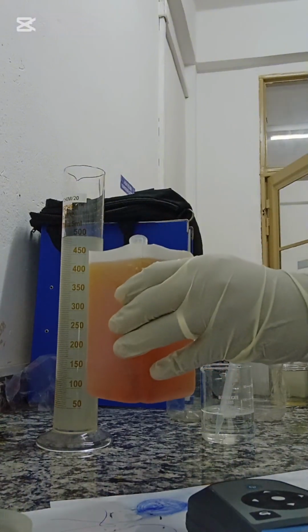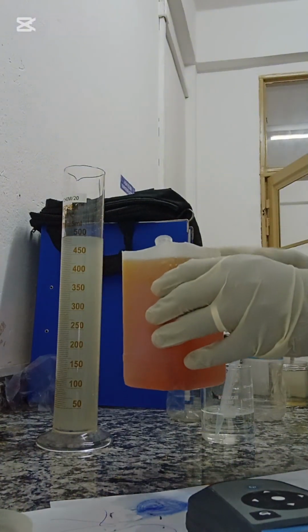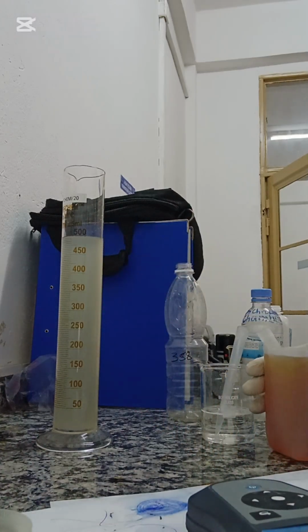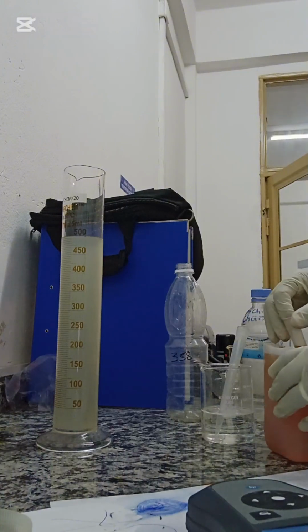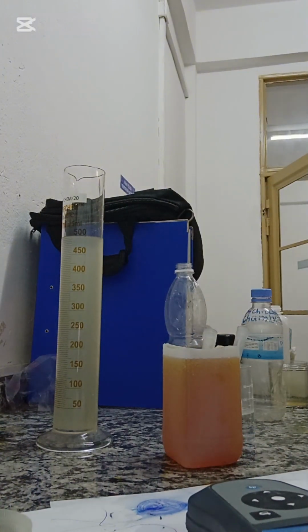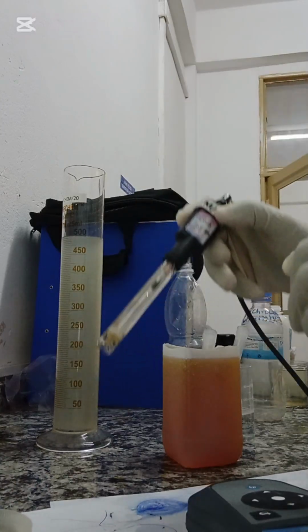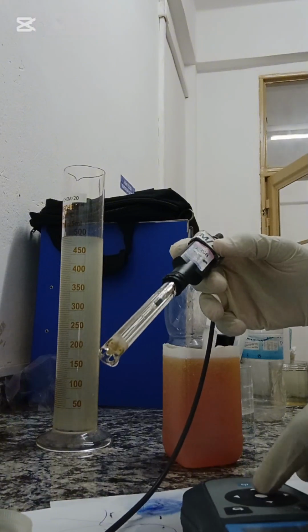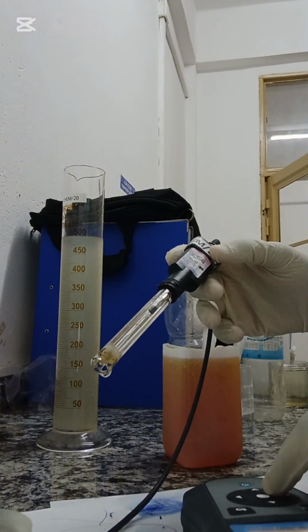So this thing I'm holding here is a solution that I've made from 40% ferric chloride. It's the 40%, and I have diluted further. So the thing I'm demonstrating is the efficiency of flocculation as opposed to filtering directly without flocculation. So this is a sewage treatment plant, and first of all I'm going to measure the pH and see the pH.